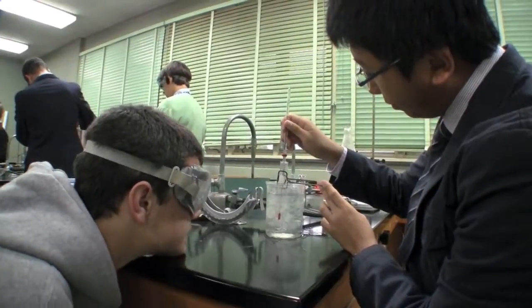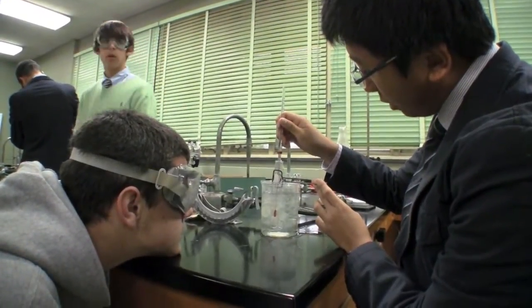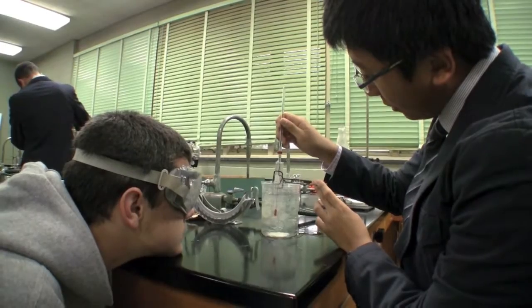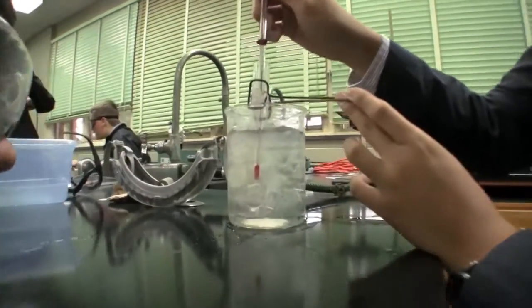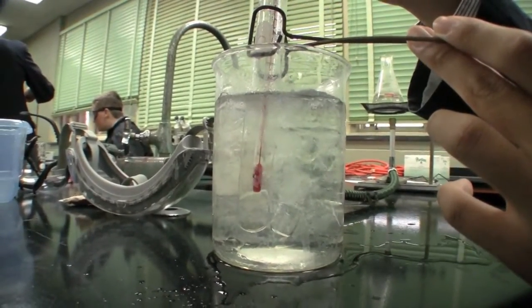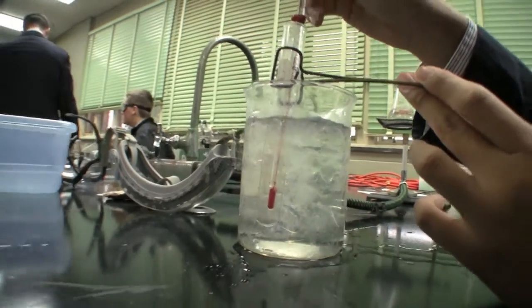Temperature. What temperature are you guys at? 10 degrees? Yeah, actually a little bit over 10. Any crystallization here? No, not yet.